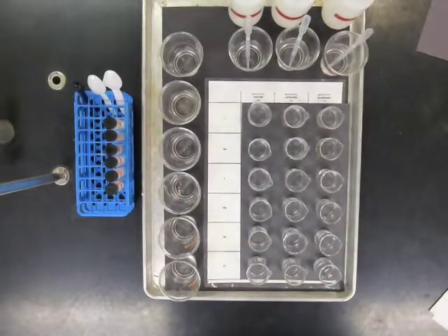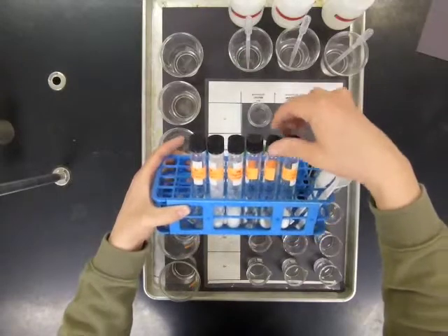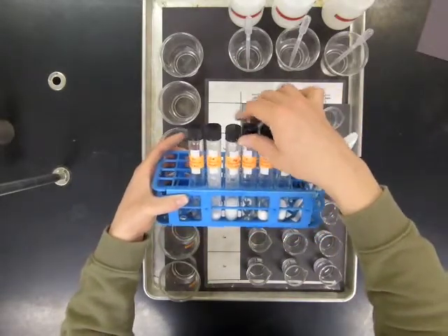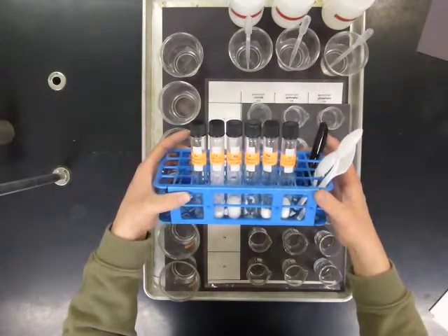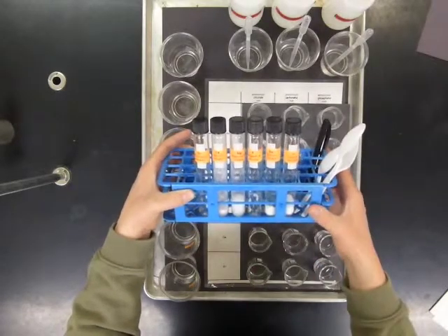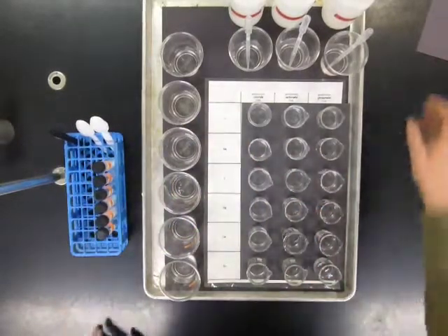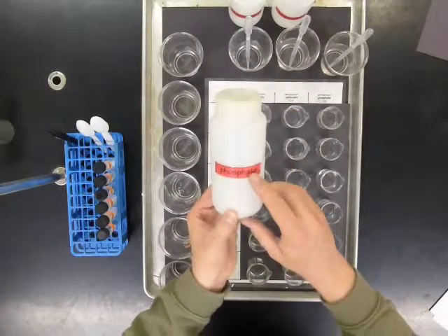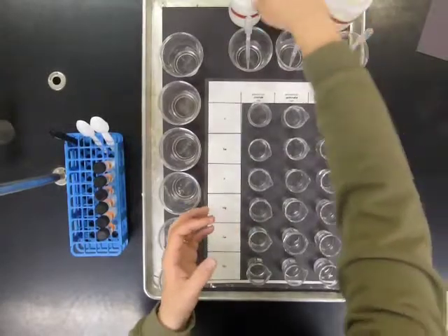So we started with some compounds, 6 different compounds. Each of these compounds contains a metal nitrate with the elements lithium, sodium, potassium, magnesium, calcium, or strontium. Those are all metallic elements, and when they react with other substances, these metals lose electrons and become positively charged ions. We combined those compounds with other compounds that contain the negatively charged ions phosphate and carbonate and chloride.